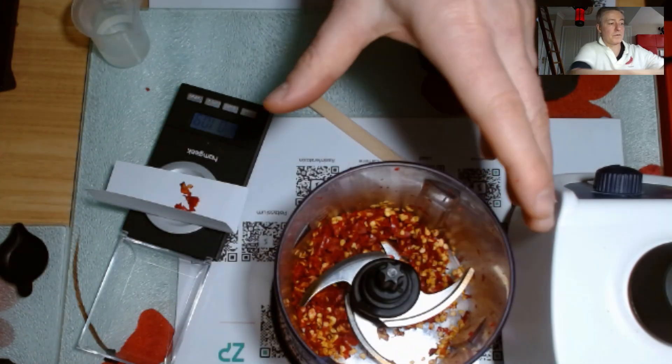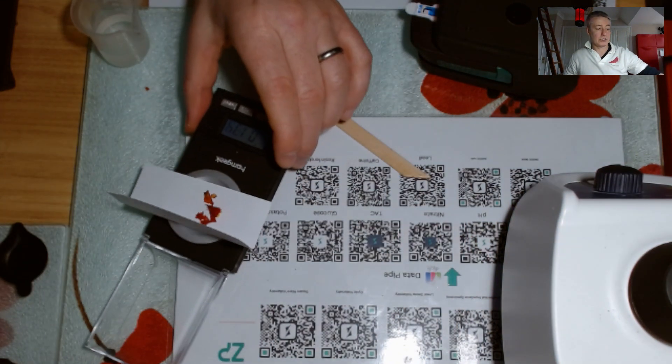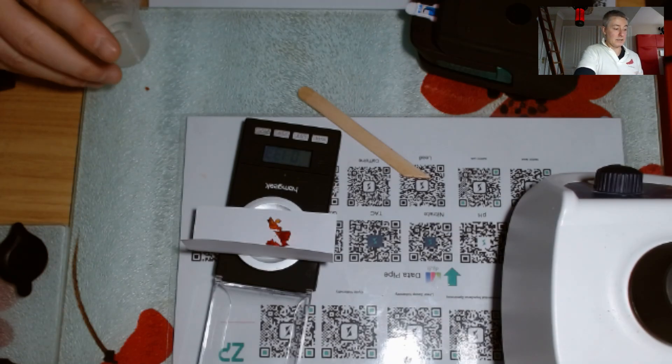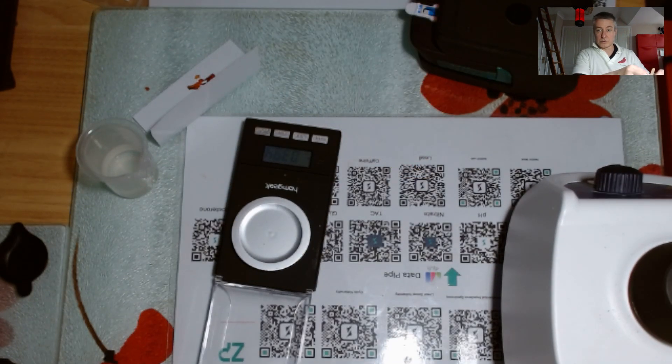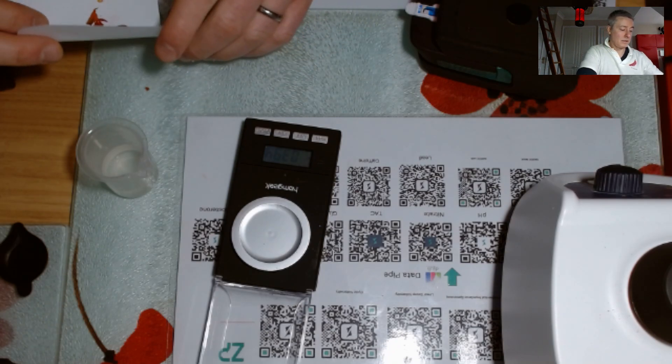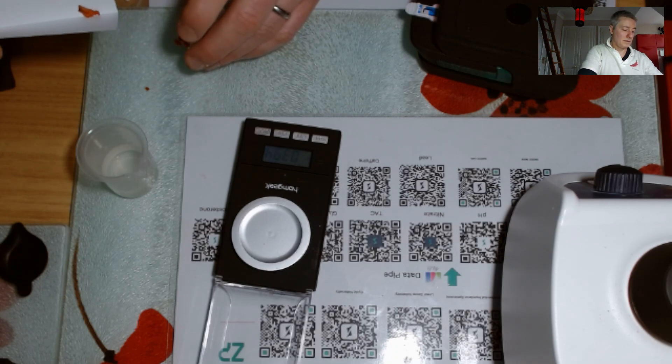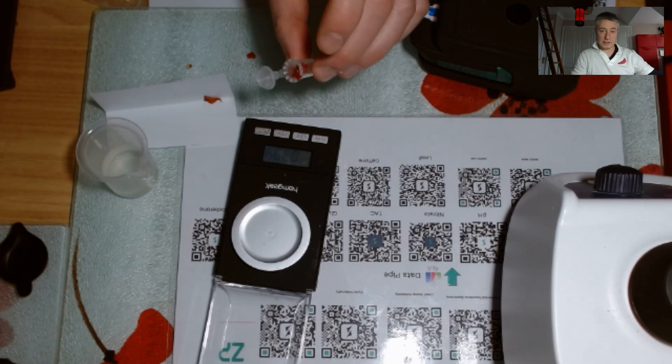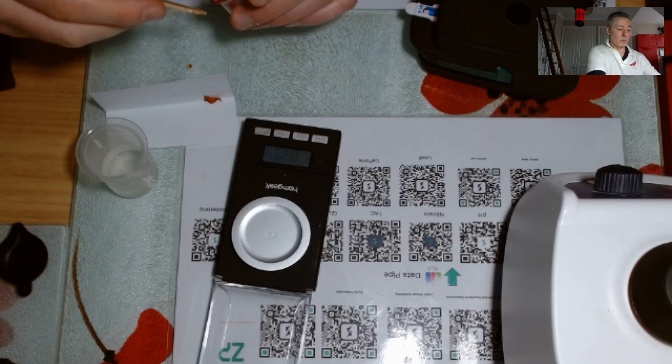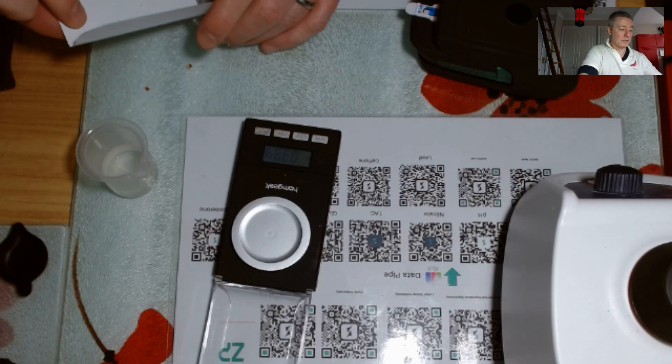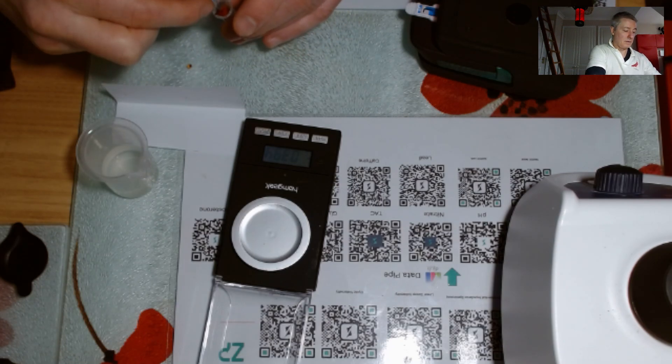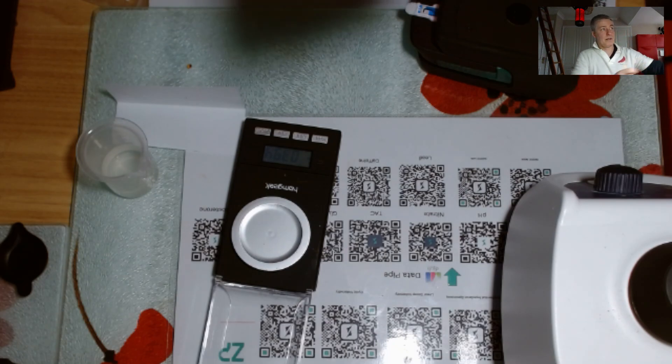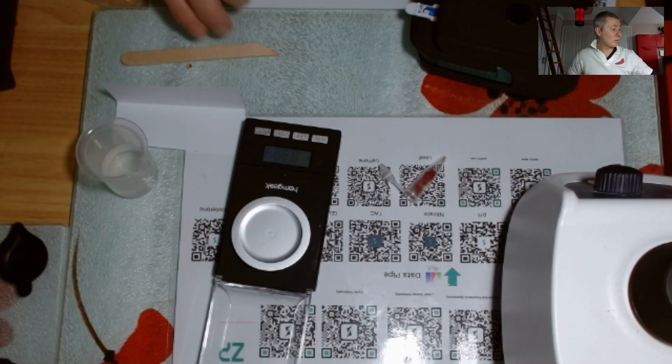Right, so I can put that away for now to give myself a bit more space. Alright, so I've got some chilli material here, I've weighed it out, I can feel the chillies. What I'm now going to do is, I'm doing this faster than I would really want to do it, but I'm going to take this now. I'm just trying to get this into this tube, so I'm using my fingers more than I would really want to.